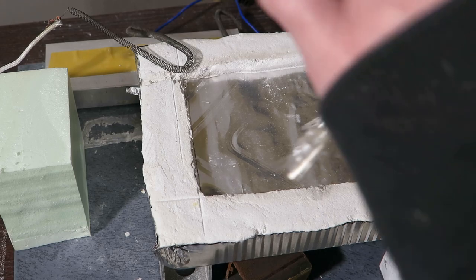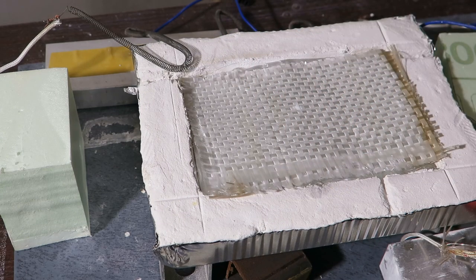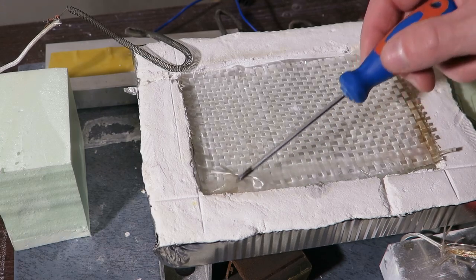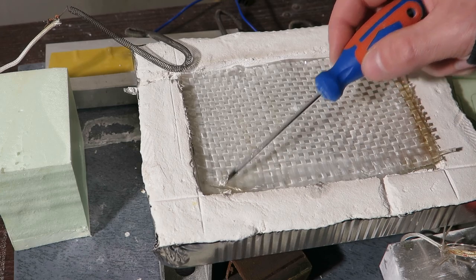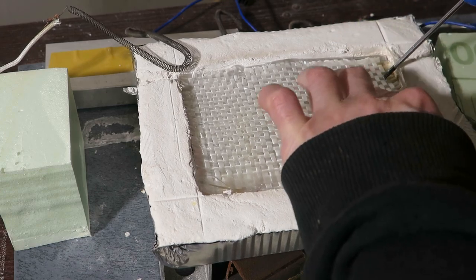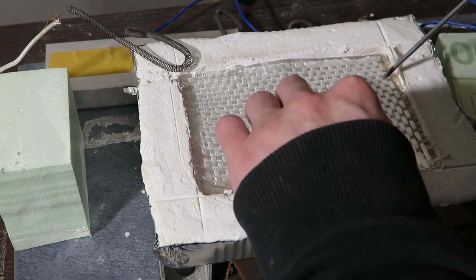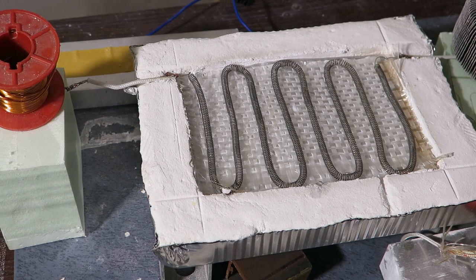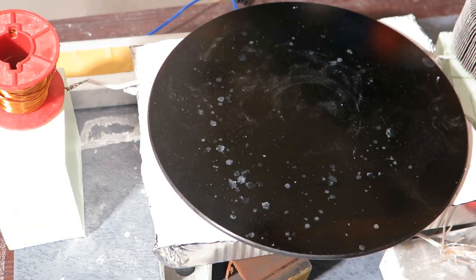So here's another heater lining that I have built, it's white this time. But I have decided to test aluminium reflector and to make it non-conductive I placed glass fibre cloth on top of it. And of course this didn't make any difference as well, at least I tried right. Now finally on top of this I will put this heating wire and finally measure the performance of the material itself.